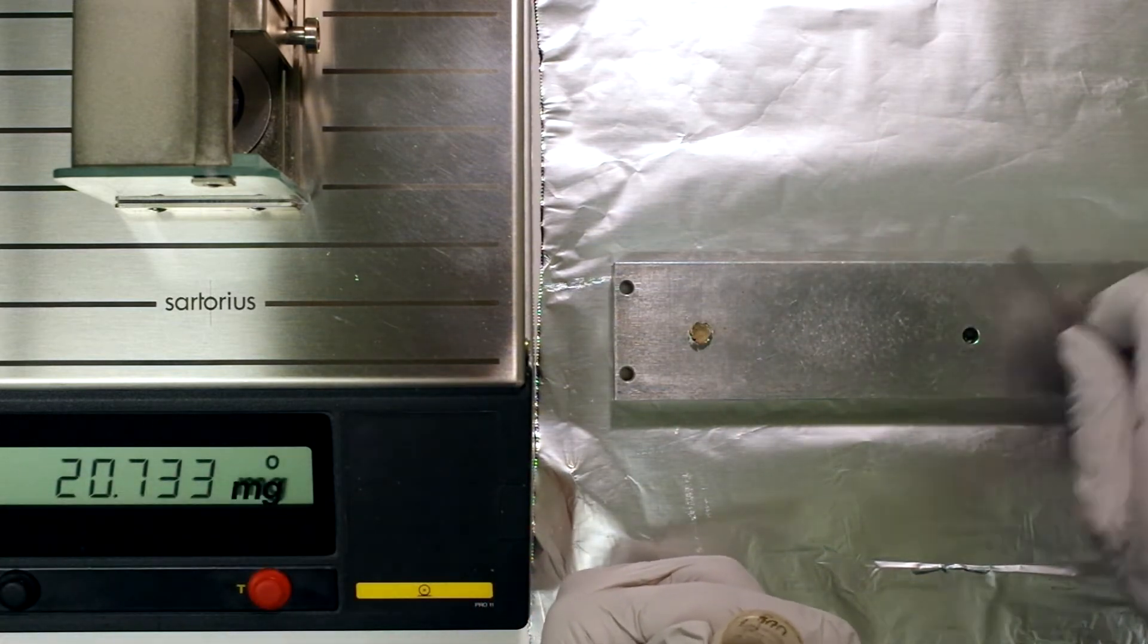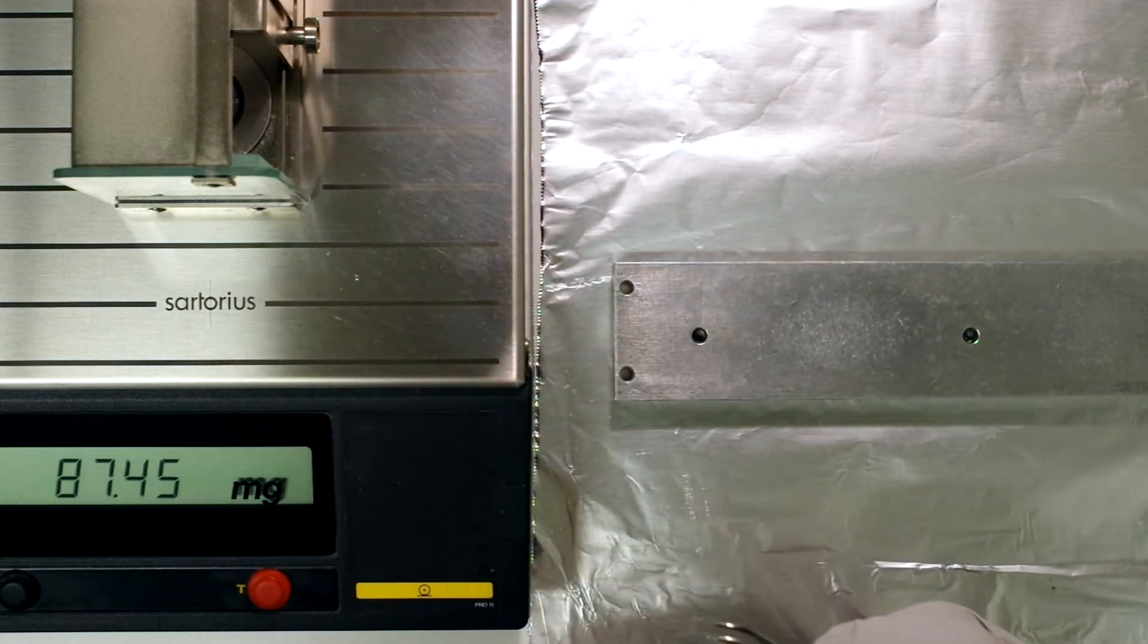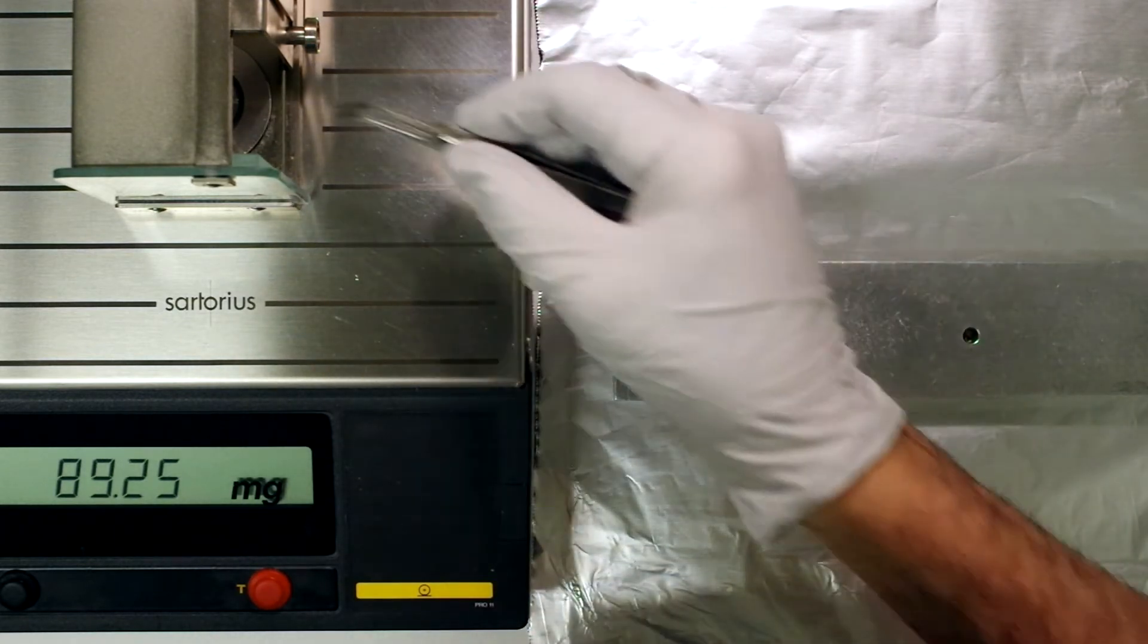I'm going to weigh it now. See how much we have. I'm up to 89 milligrams.